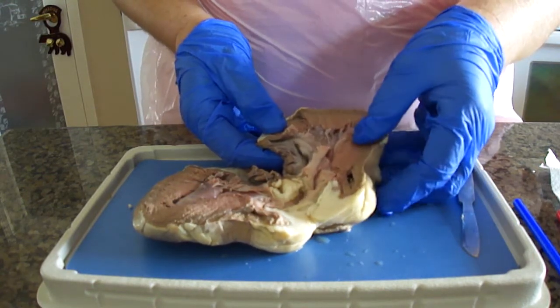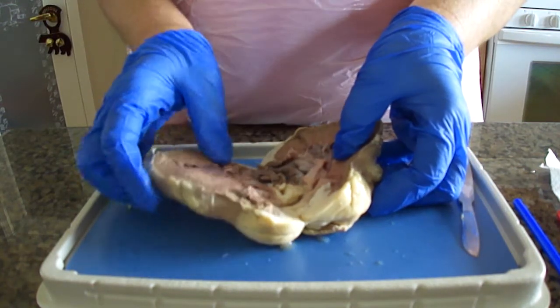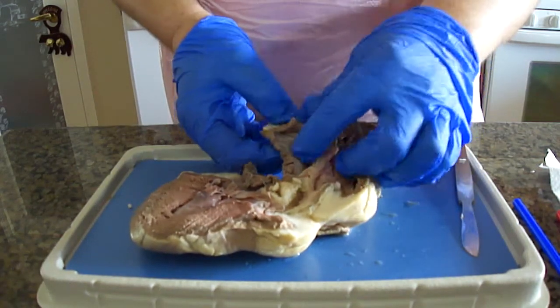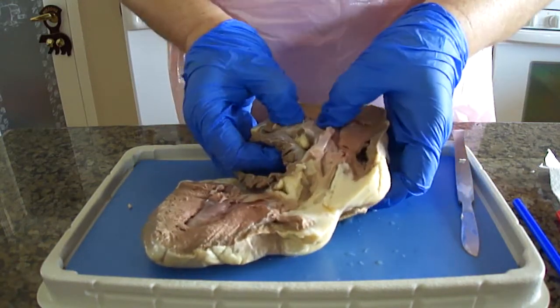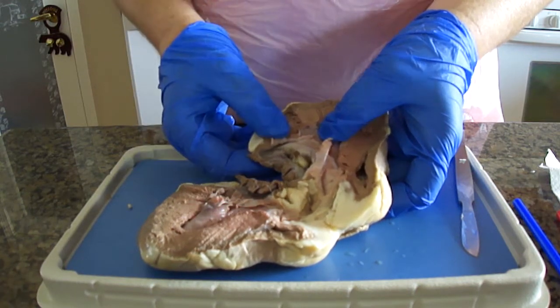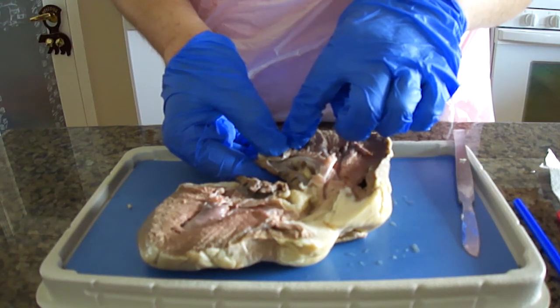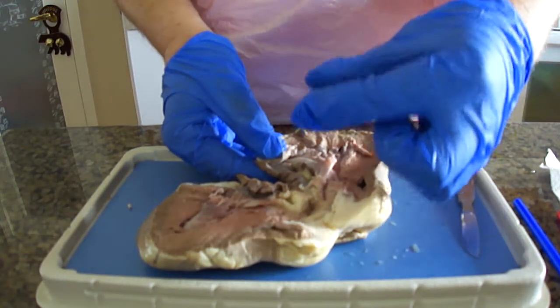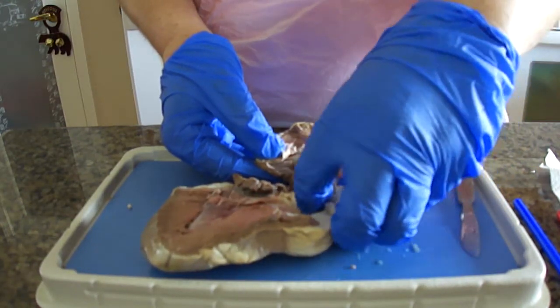The tricuspid valve, which is also known as the right atrioventricular valve, is in the right atrium, and it is made up of 3 flaps or cusps. I don't know if I can get them open here. It prevents the backflow of the blood from the right ventricle to the right atrium, and the blood is forced behind the 3 valve flaps when the ventricle contracts, and this forces them upward and together to close the valve.